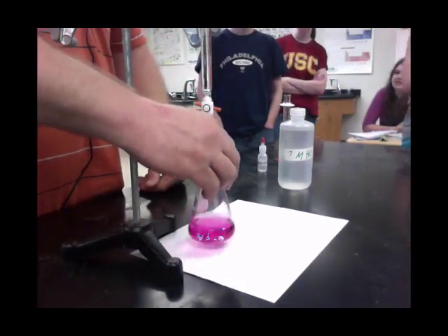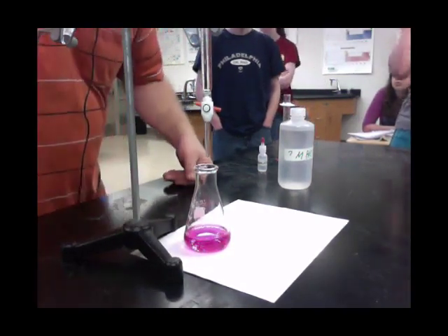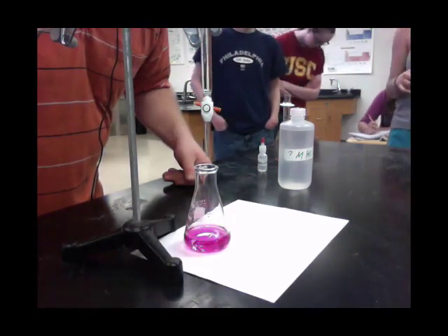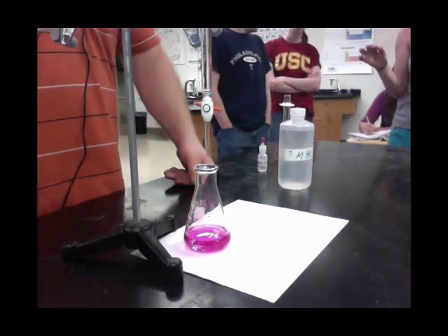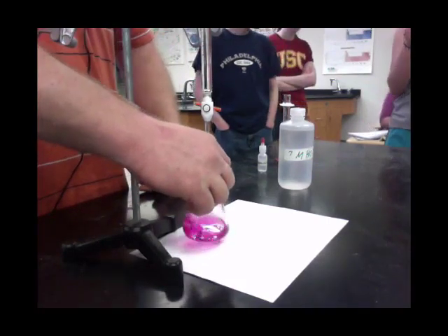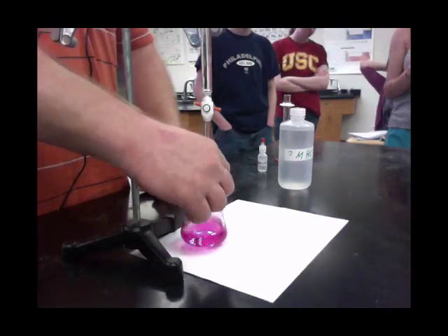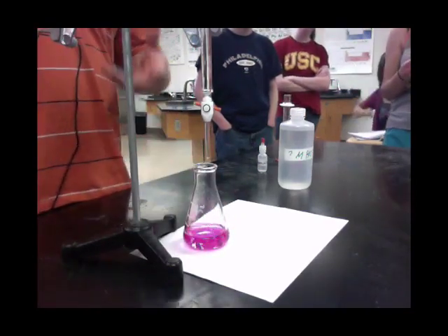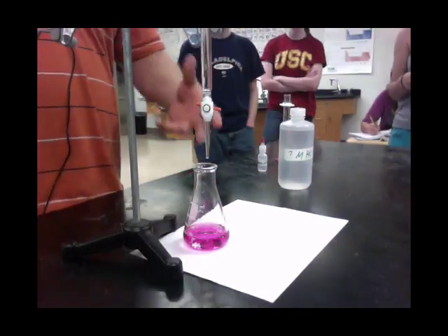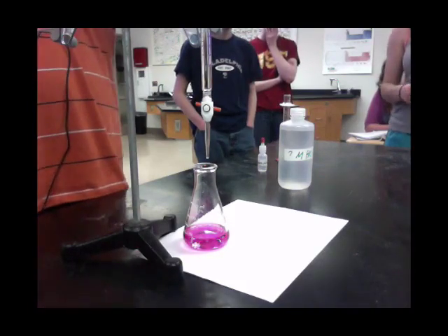Did I overshoot a little bit? Maybe by a drop. If you look, I was not quite 18 and my final volume now is 17.90. So final volume is 17.90 and my initial volume was 3.85. I would say that's a pretty good trial. I might be a drop or two over — each drop is about a tenth to a twentieth of a milliliter.